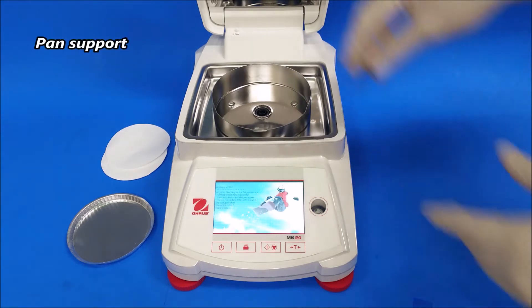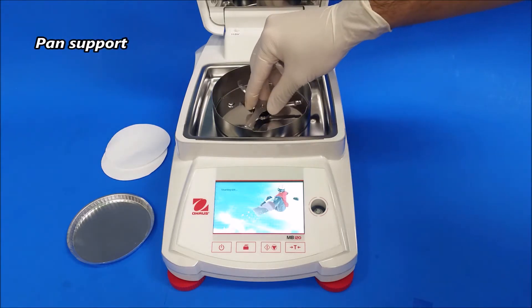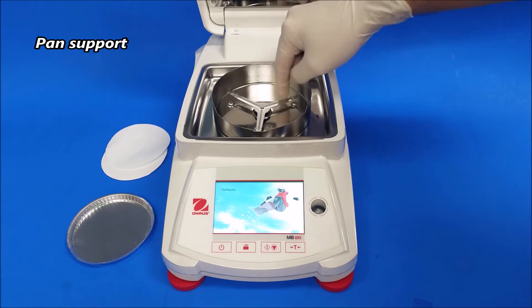Last piece, the pan support. It should fall into place. There you go.